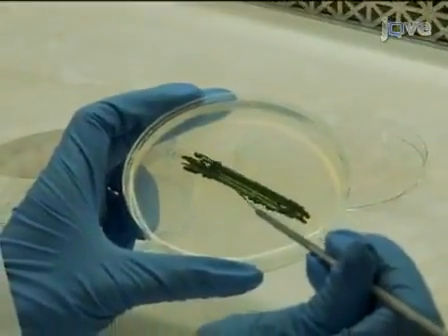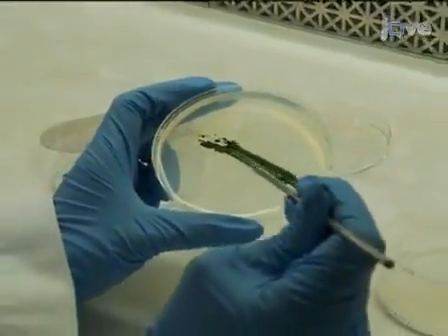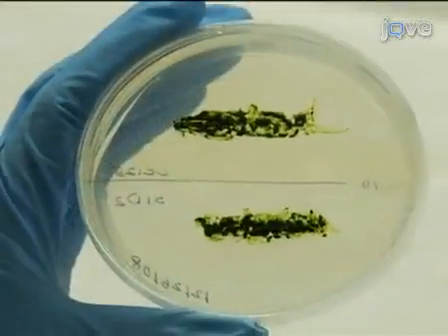Hi, I'm David Stern, President of Boyce-Thompson Institute for Plant Research. Today we're going to show you procedures for mating and tetrad dissection for the model green alga Chlamydomonas reinhardtii.